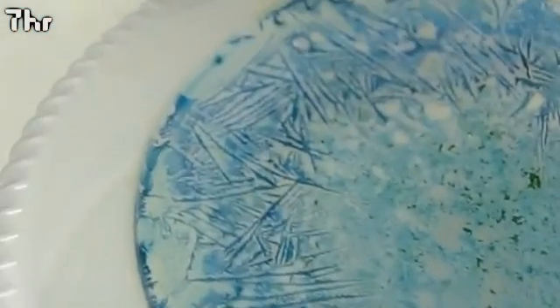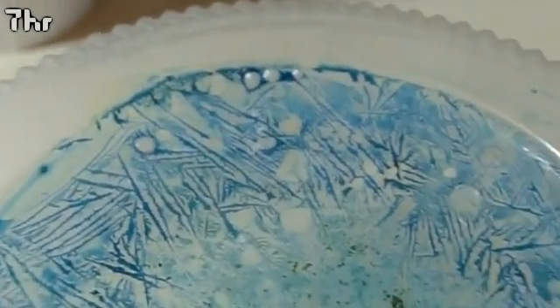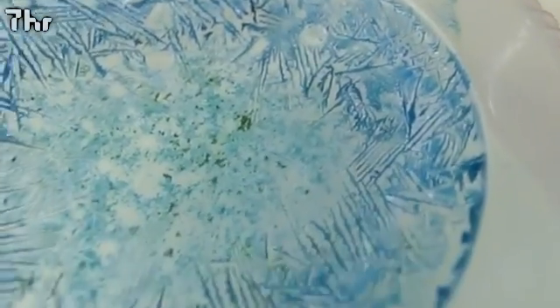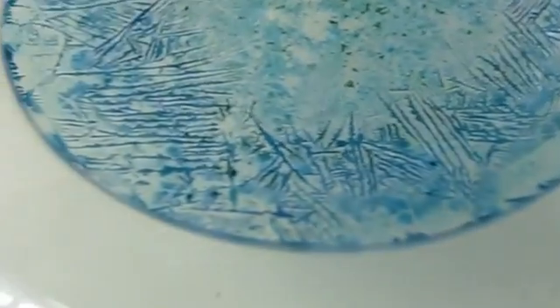It's turning out really cool. This is about seven hours into it, or maybe eight. There's a little bit of solution left. I'm betting by the time I wake up tomorrow it'll be all gone. Up next is just a bunch of high-res pictures I took.